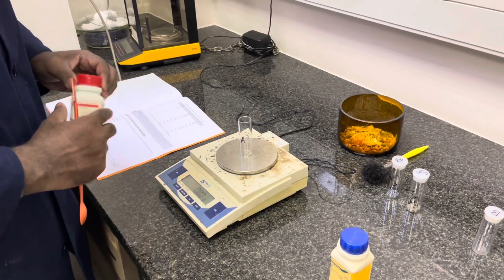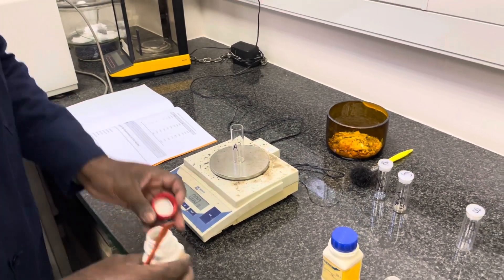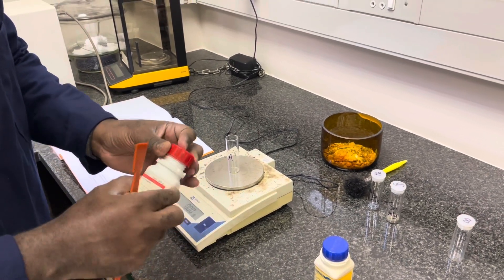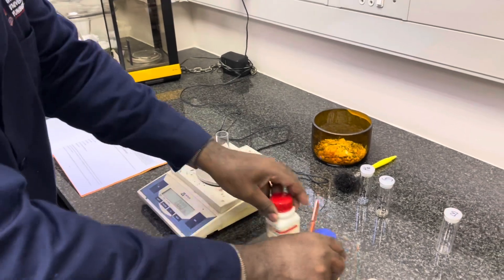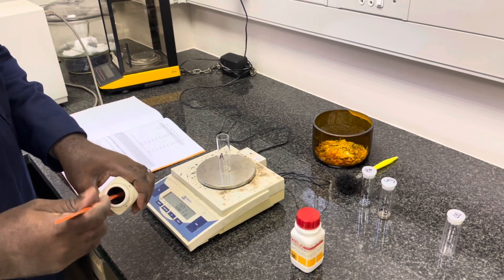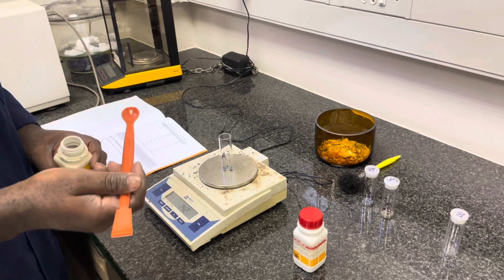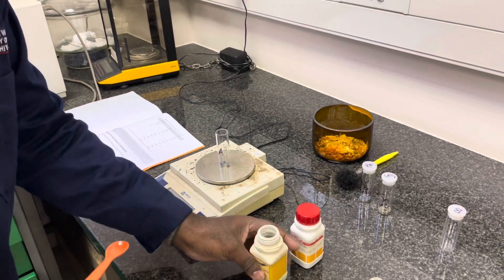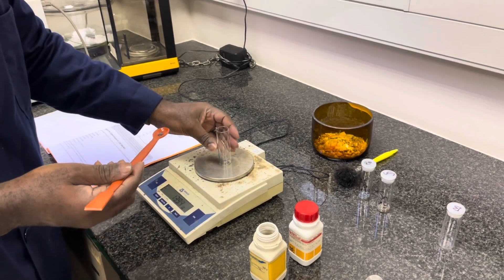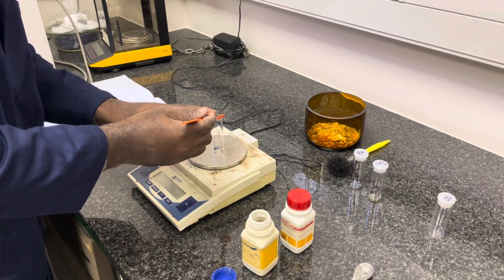When preparing the lead and tin mixtures, you first need to weigh off one of the specific reagents — either the lead or the tin — in the polytop vial and get to the appropriate mass. Thereafter you will add the second reagent, first weighed off in a separate vessel. A specific vessel will be provided, either a plastic cup or a different polytop, and then you can combine the two together in the polytop vial labeled for that specific mixture. This is what we will now illustrate.